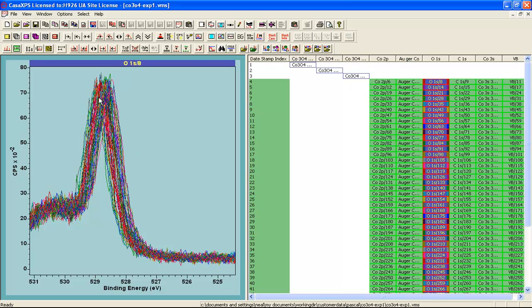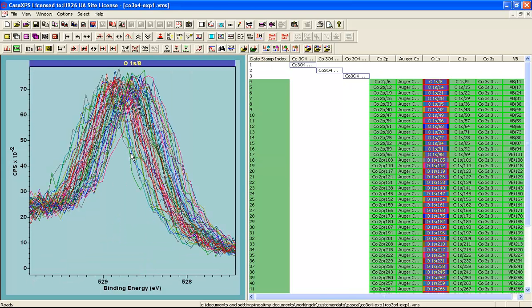And the oxygen peak is moving around. We can see here that the oxygen signal is not stable, and these represent small perturbations in the steady state at the beginning of each one of these acquisitions, or at least that's what we hope, because in order to do charge correction on this type of data set, we need to make the assumption that the sequence of measurements that are all in the same row all have the same charge state. The underlying assumption when we perform charge correction is that we can identify a peak and a position for that peak that we can assign a binding energy. And then, once we've assigned a binding energy for one of these peaks, we can calculate an offset which can be applied to other spectra in the same row, representing data that were collected under the identical charge state conditions.